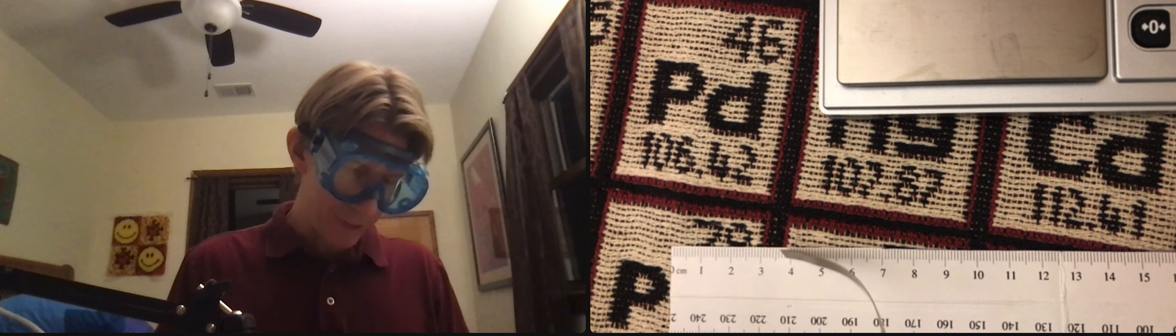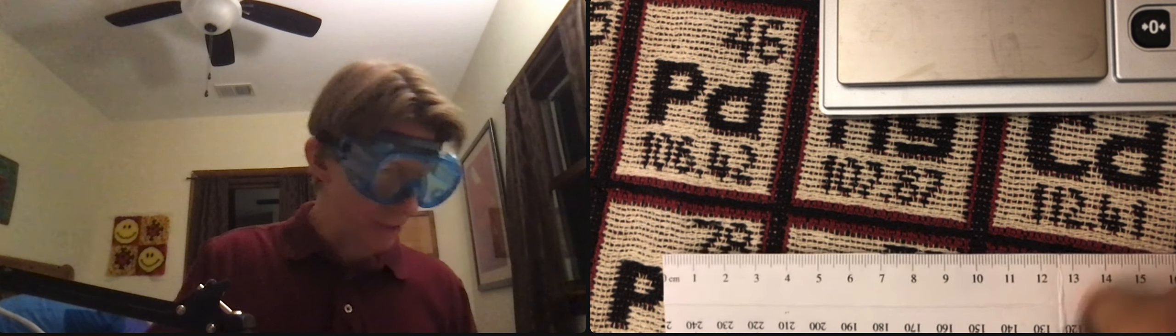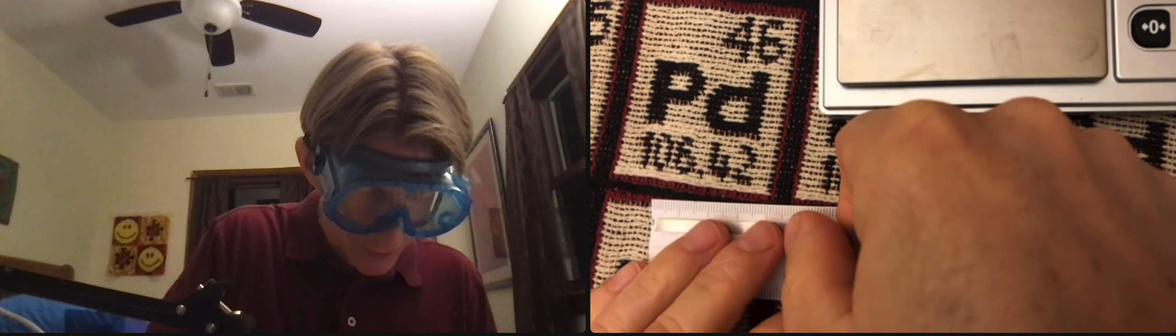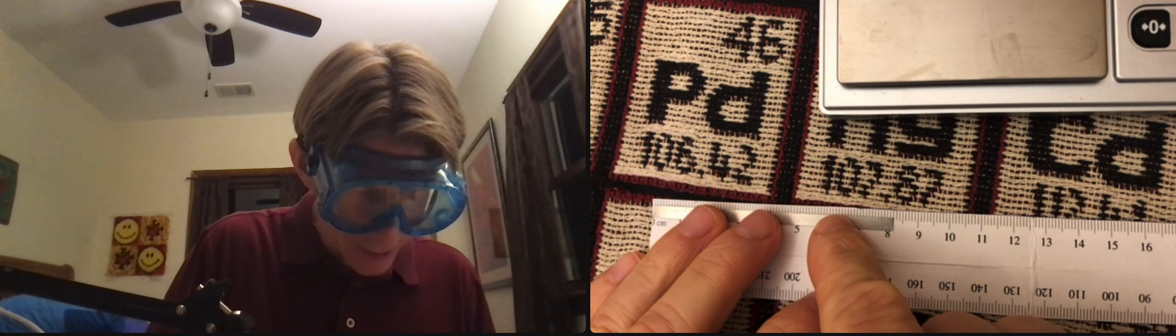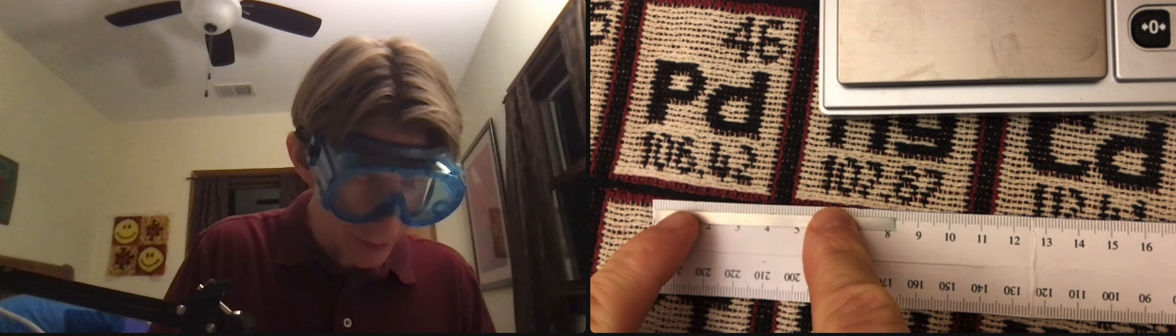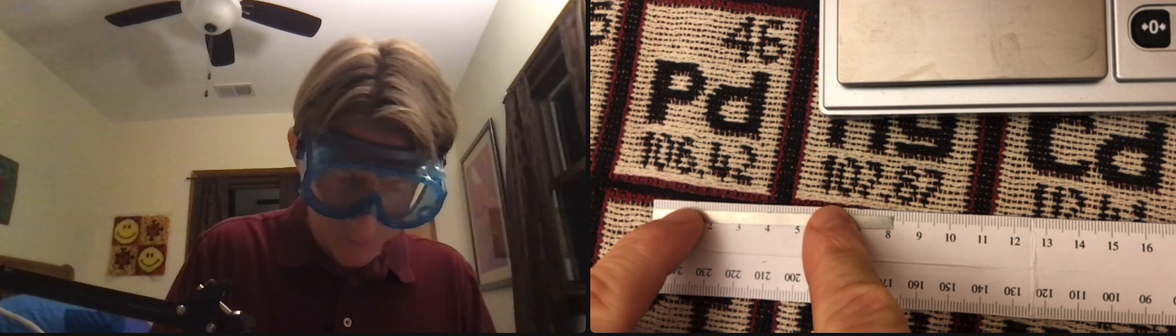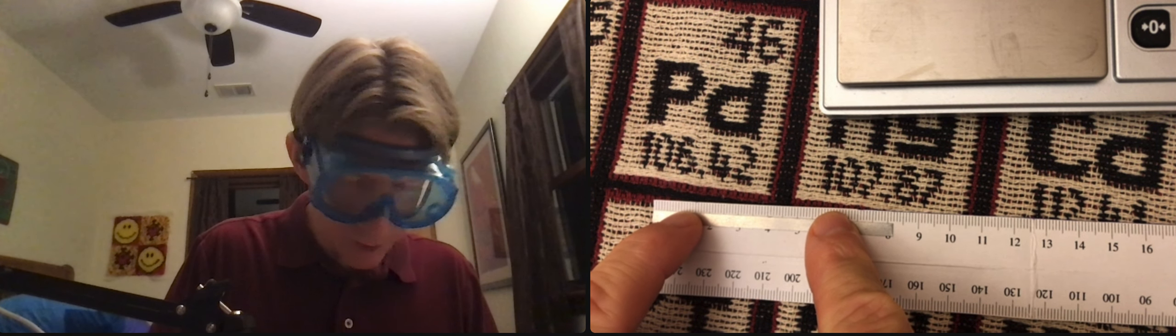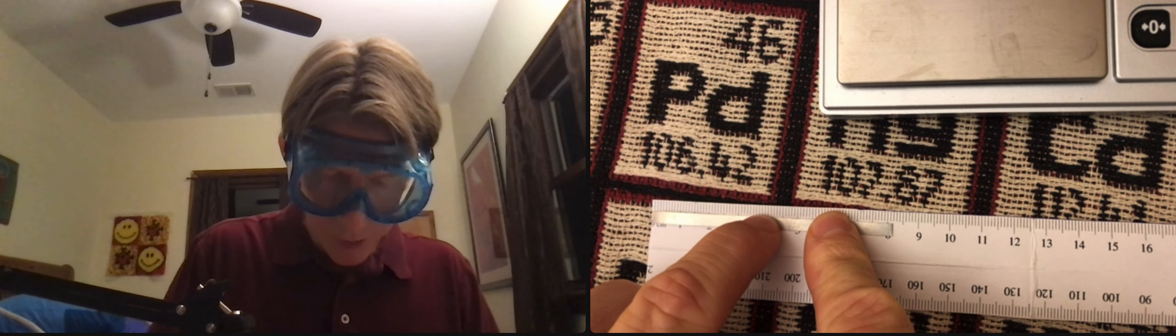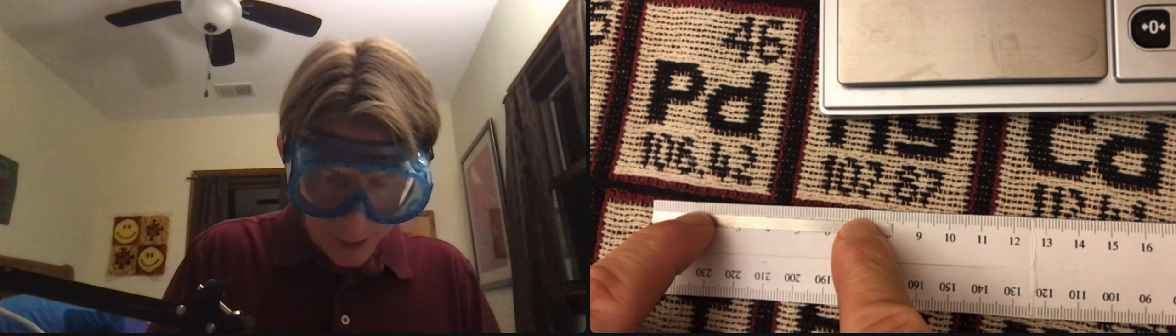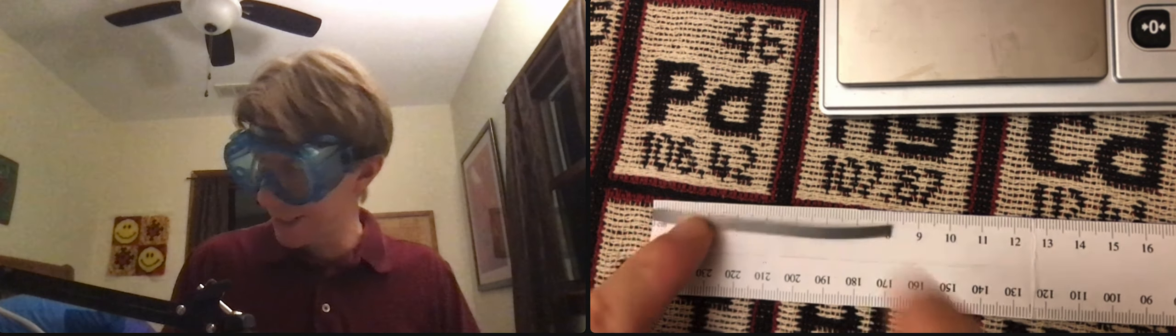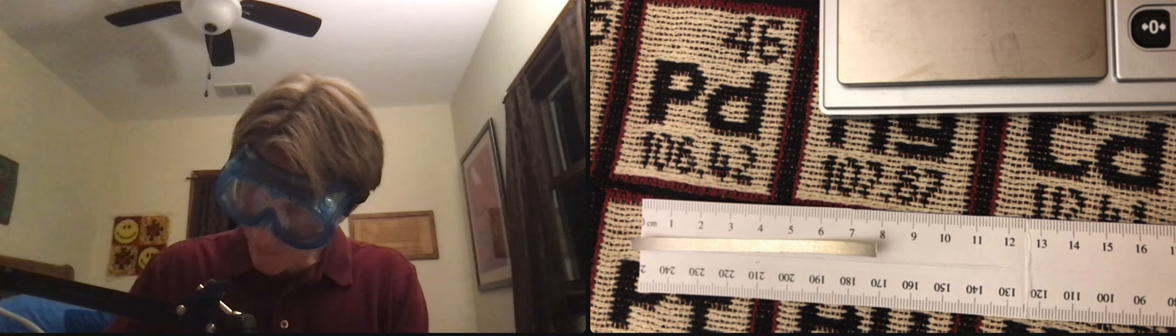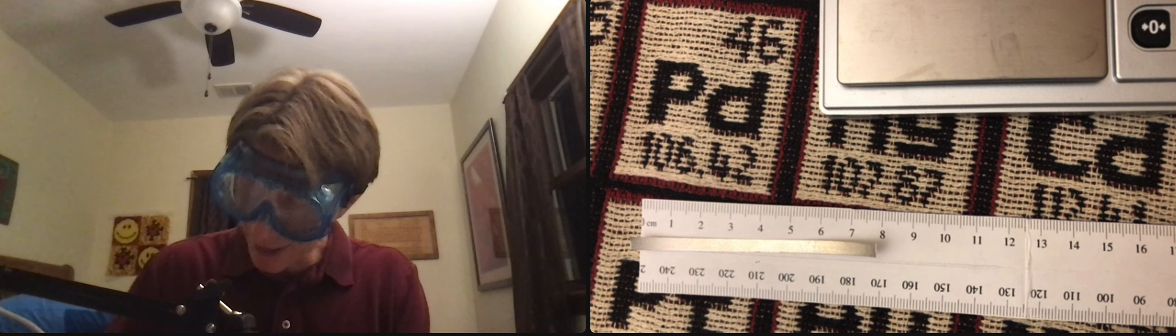But what does matter is that whatever length we cut, we actually measure it exactly. And I'm going to stick, so I have my ruler right here so that the end, very end, is 0, because it's right on that 0 line. And I've got 8.1, 8.1, I'm going to go with 6. 8.16 and whatever, and that's in centimeters.